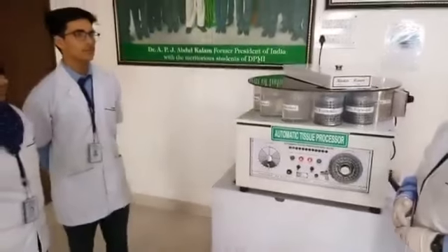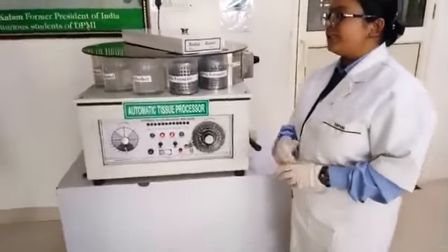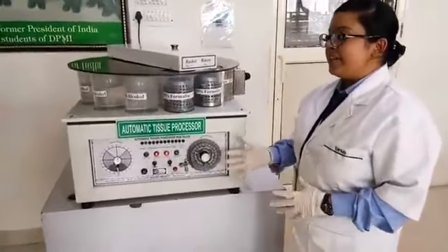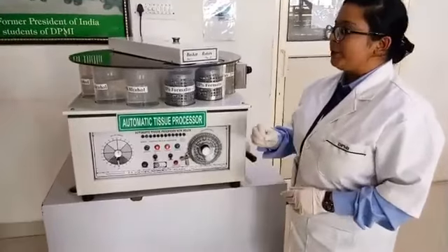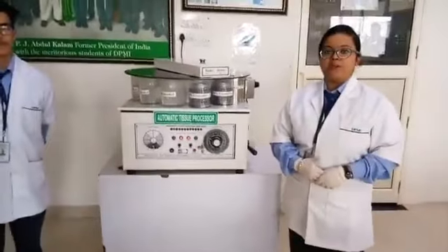Next. What is the main advantage of automatic tissue processing? The main advantage of this tissue processor is it decreases the human error. Secondly, it saves time and it gives accuracy in our results. Thank you and hope you have enjoyed this video.